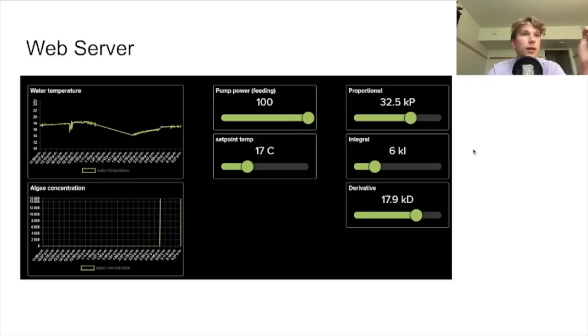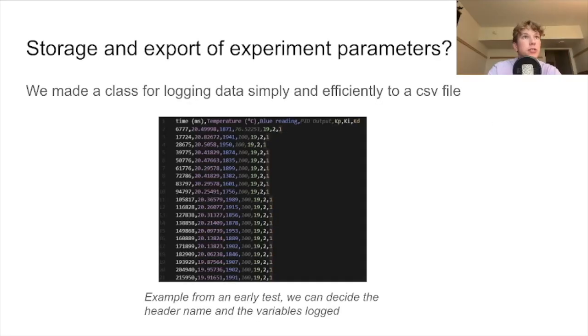On our web server, we have decided to monitor algae concentration and temperature, while we also have sliders where we can change the individual coefficients of the PID controller. For our storage and export of experimental parameters, we initiate a CSV file with the headers seen here. At the end of every loop, we write the relevant variables in the CSV file. We can also see or retrieve data from the Adafruit dashboard if we wish.